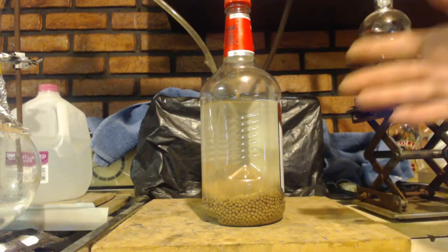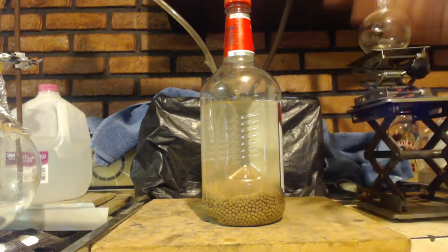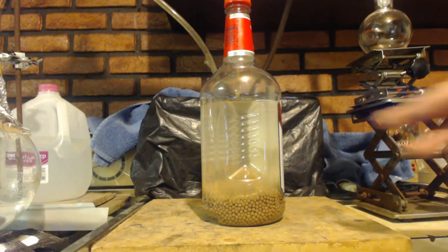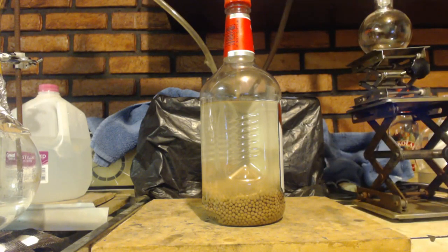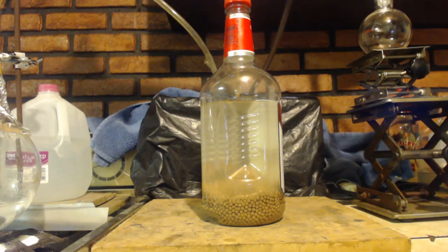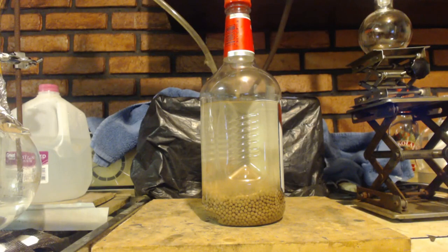The thing I just did with the water, adding them to the sieves, it did a spike of 35 degrees Celsius. It jumped up 35 degrees. I mean, it probably should have been maybe 60, 70 degrees jump. So they're not perfect, that's for sure.